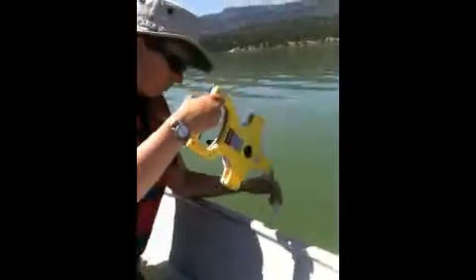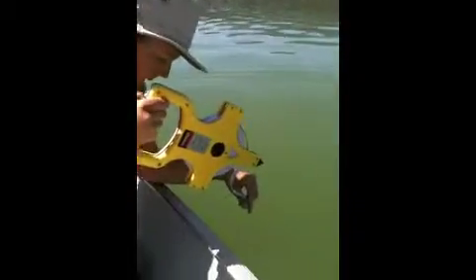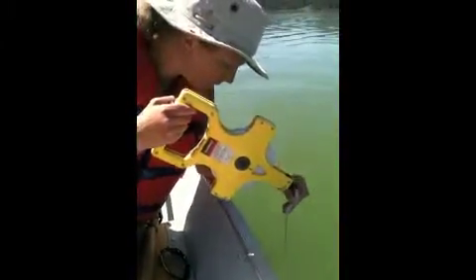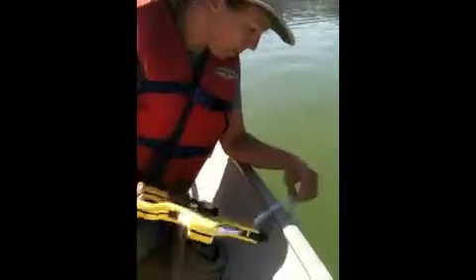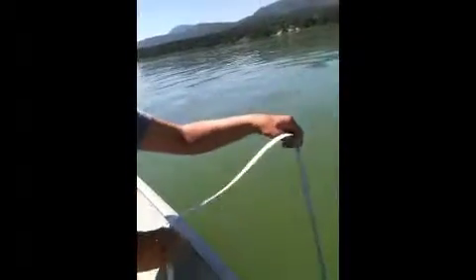I'm lowering it down on the shady side of the boat. I can still see it. You have to raise and lower it a couple times. I lost sight of it. Measure that down — one meter and a half.